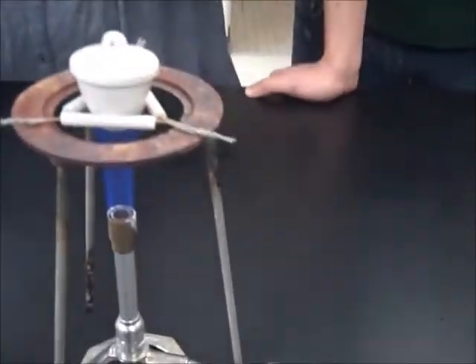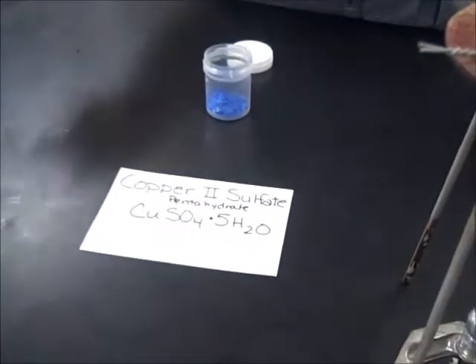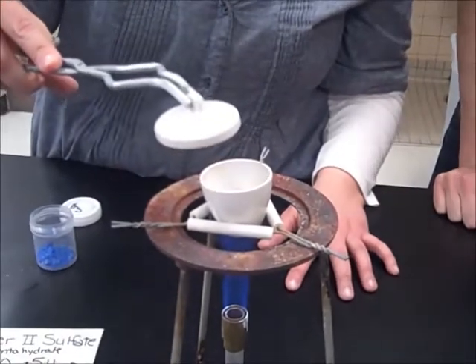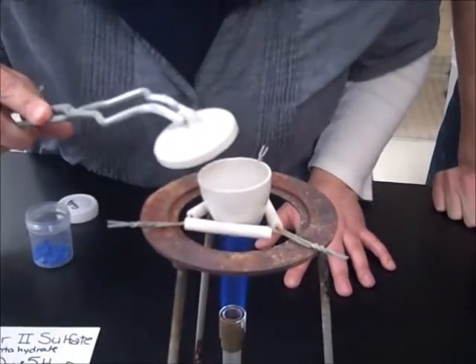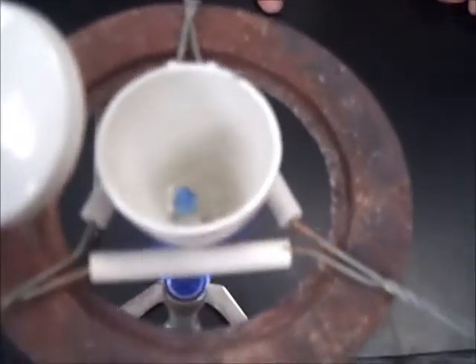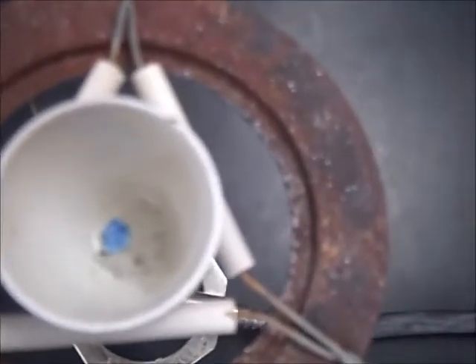All right, let's see. Basically what we're going to be doing is breaking down the copper sulfate into its 2 parts, which would be just copper sulfate and water. So I don't know if I'm going to see any steam here. Not yet. Anything happening? I can hear it sizzling. If you look at it there, Miss Saget, you will see that it's actually starting to lose its pretty blue color. Yes, it's quite lighter.